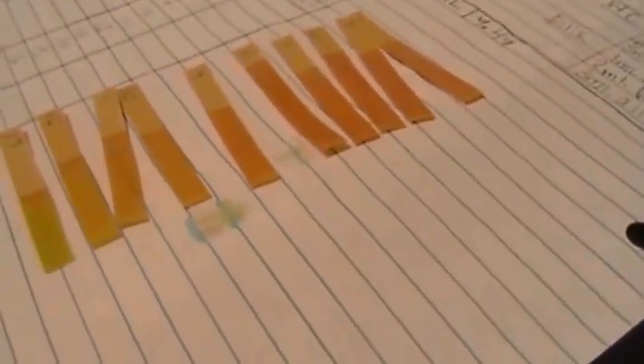Stay positive, team. We just had a really steep change on our 13th milliliter of base and it's kind of tinted. But look at that — that is definitely closer to seven than previously before.